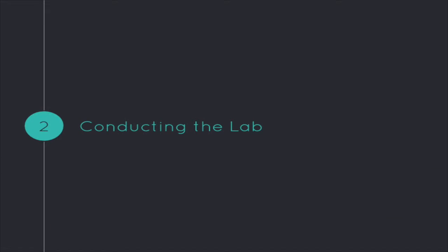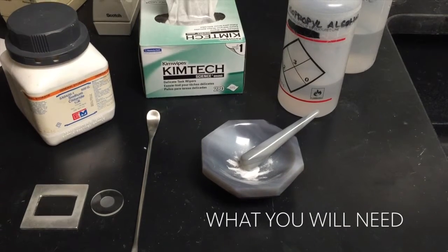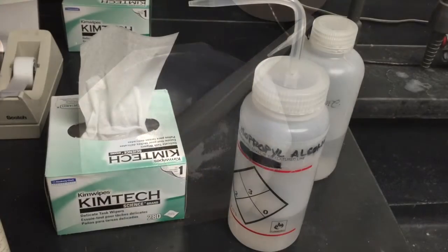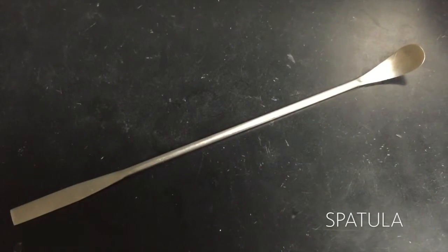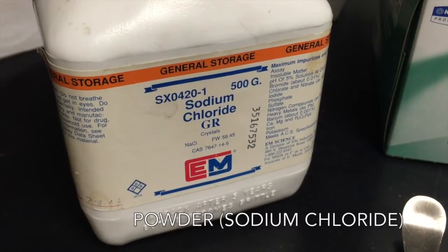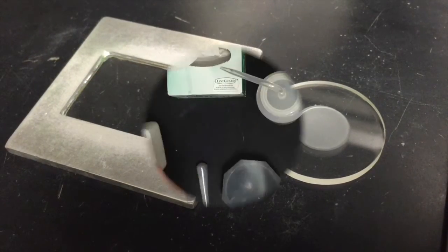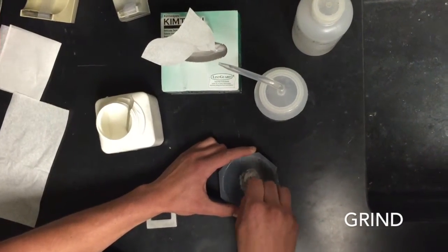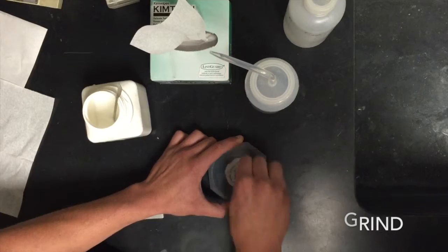In order to conduct an XRD lab for yourself, follow these steps. To conduct the experiment, you must first prep your sample using the following: a mortar and pestle, wipes and isopropyl alcohol, a spatula, a powder of some sort, and mounting slides. Once you've compiled all of your materials, you must grind your powder to make it a finer grain. When your powder is at a texture to your liking, you must place it on the mounting slide.